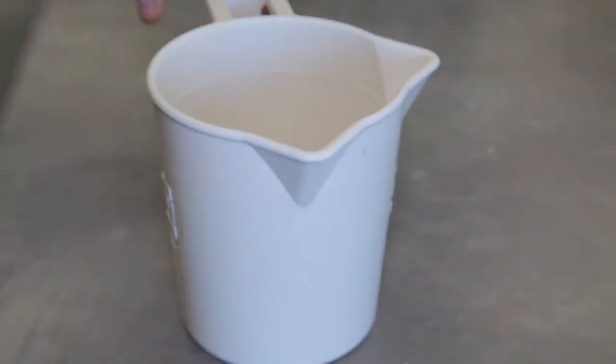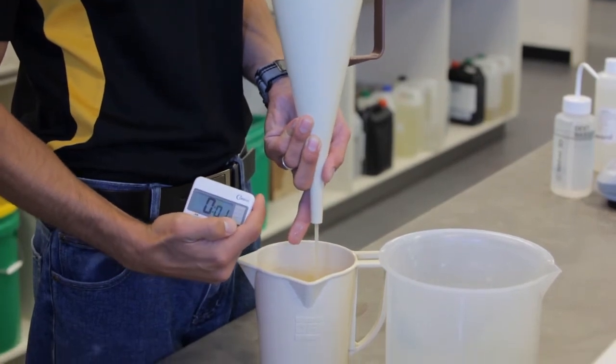Once the funnel is filled to the line, prepare the cup. Then, release your finger and start the stopwatch at the same time.